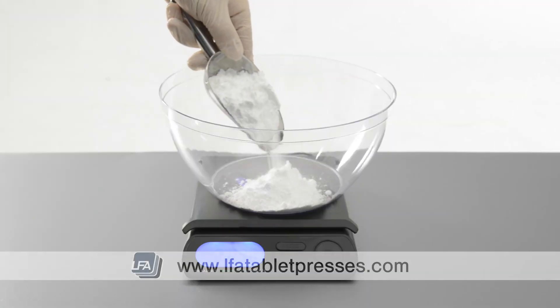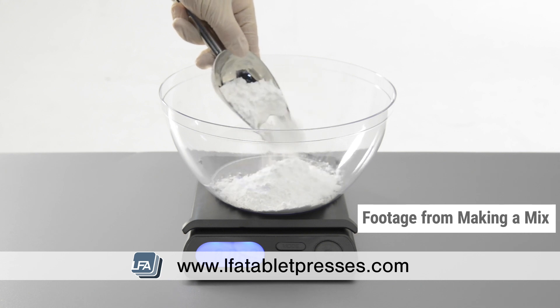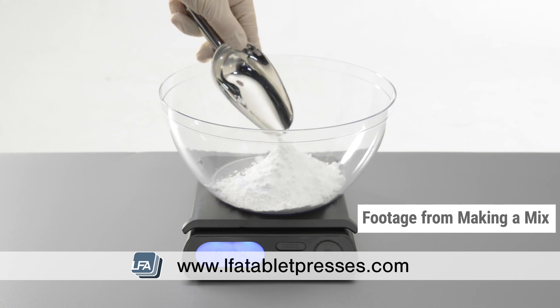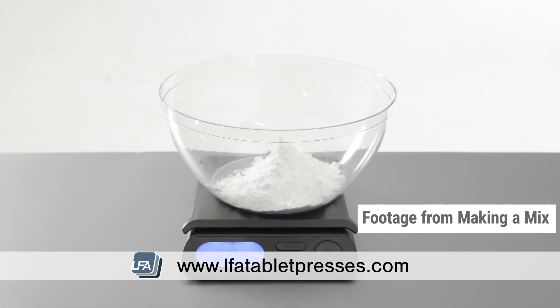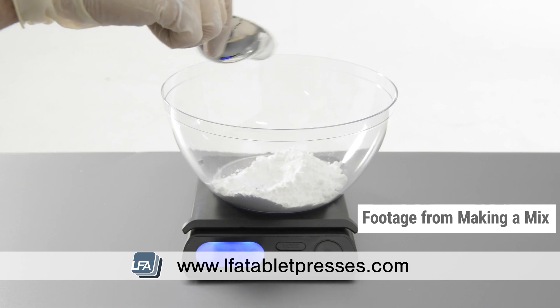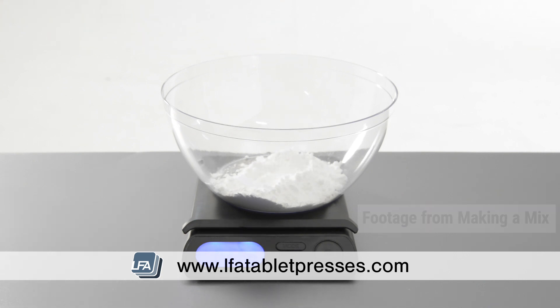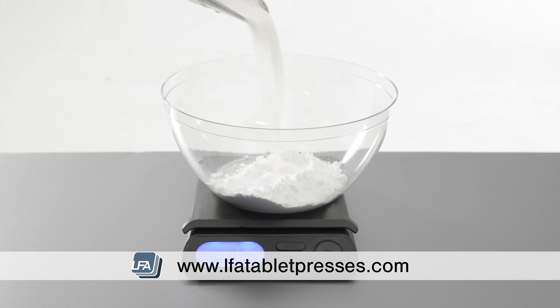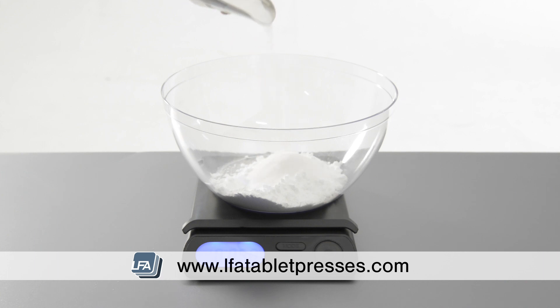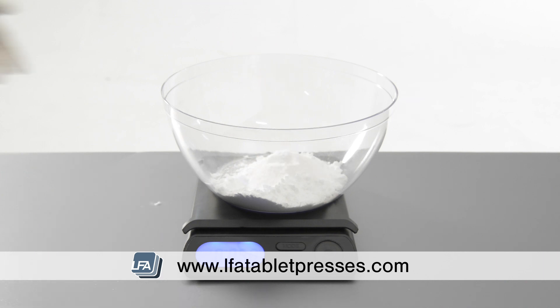Hello and welcome to LFA's guide to bulk density. A small change in powders can make a dramatic change to your tablets, making it important to measure the characteristics of powders and granules during production. Bulk density should also be checked from time to time as ingredients can change and be affected by things such as humidity.